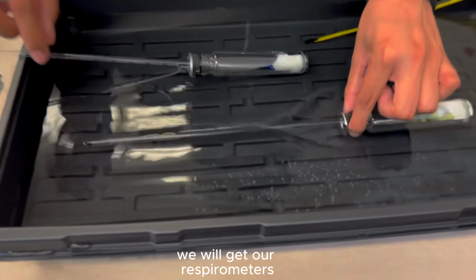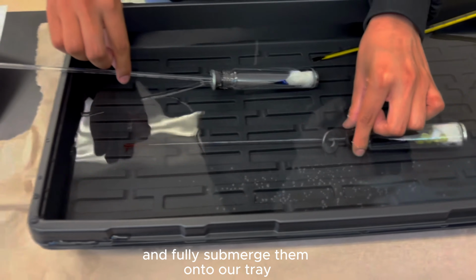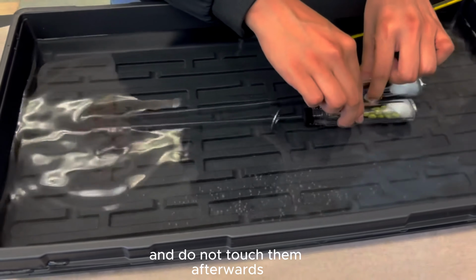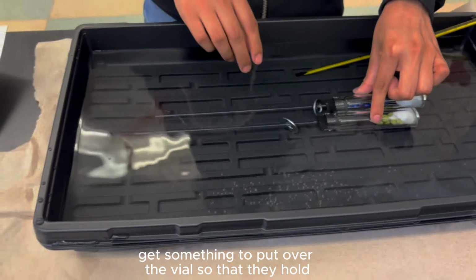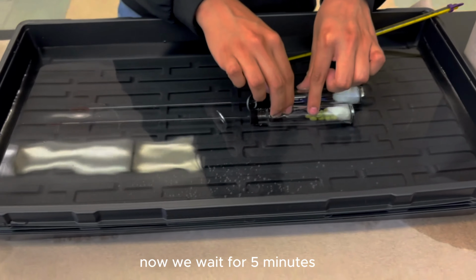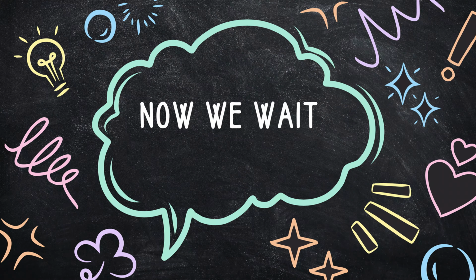After the 1 minute is done, we will get our respirometers and fully submerge them in our tray. Make sure they are fully submerged and do not touch them afterwards. As a tip, get something to put over the vials so that they hold. Now we wait for 5 minutes.